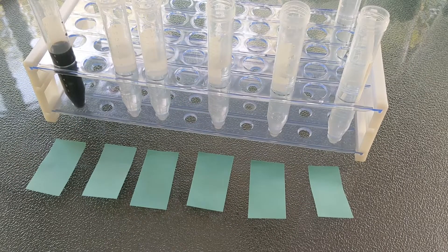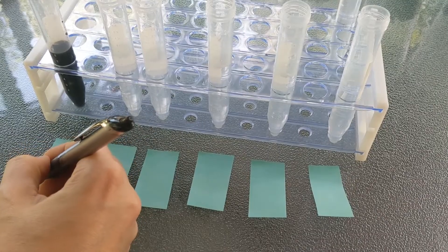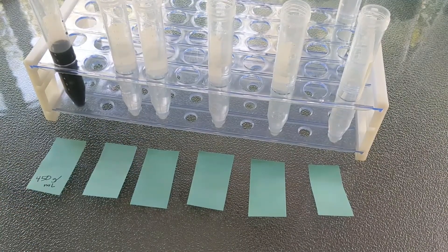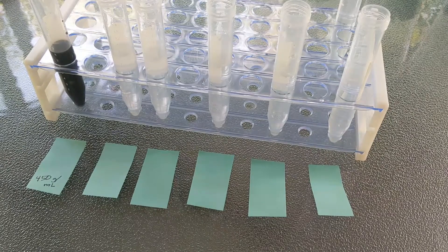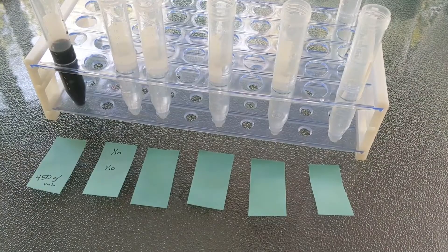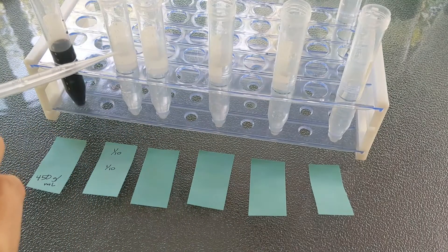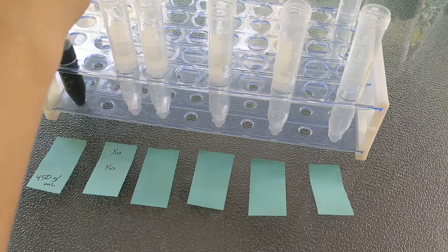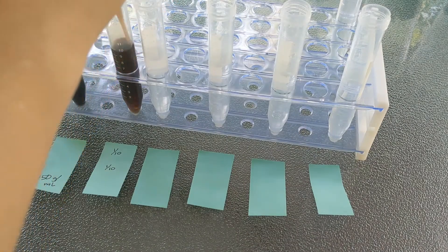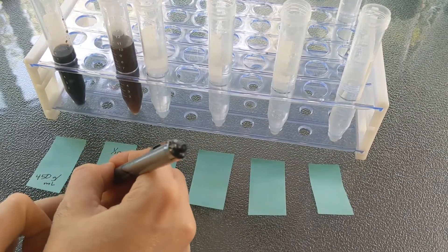We are now going to do our final demo with test tubes, diluting one-tenth each time. We're going to pretend our initial tube has a concentration of 450 grams per milliliter — I'm really just using food dye — but I want us to work with this to practice different units. I measured all tubes to have 9 milliliters so I can add just 1 more, and 1 out of 10 is one-tenth, making the math nice and easy. Using a calibrated pipette, I pipette down into the next tube. One-tenth of 450 is 45 grams per milliliter.